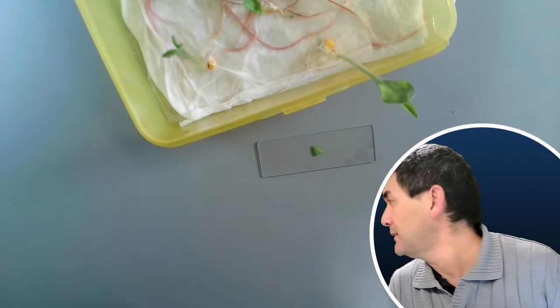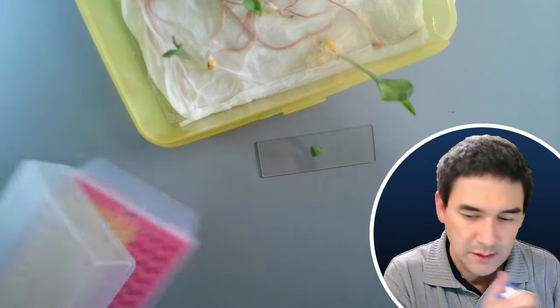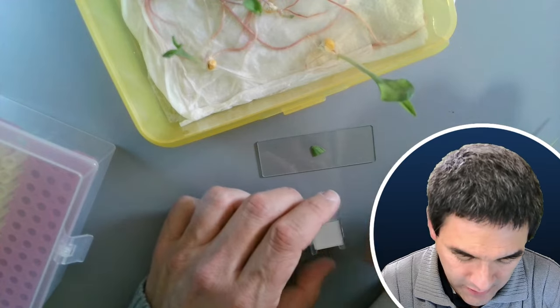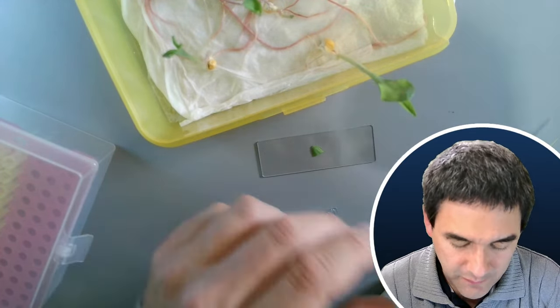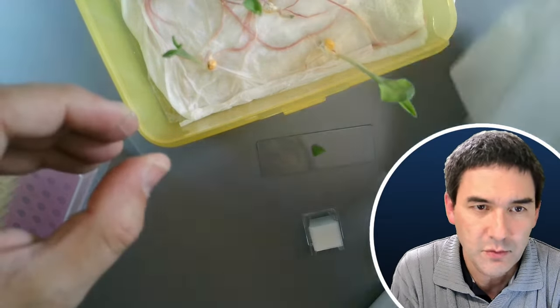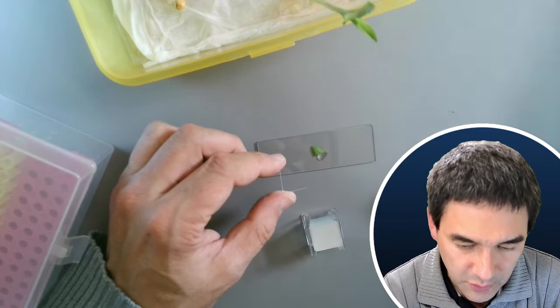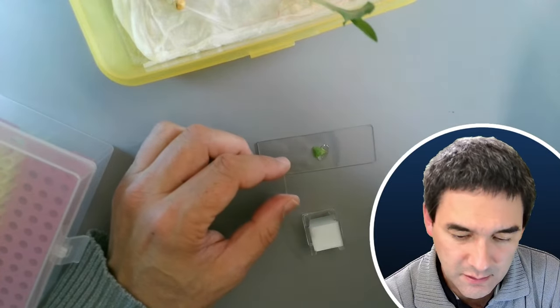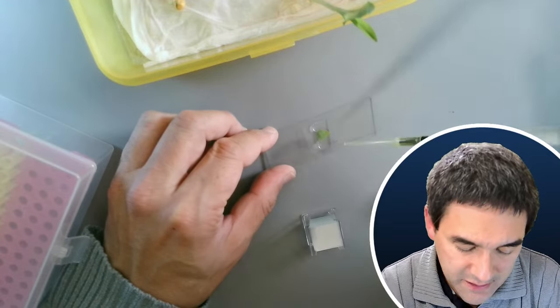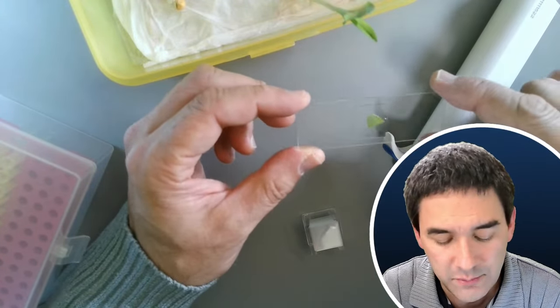I put a drop of water on here — water is important to make objects more transparent — and add a cover glass. It's way too thick. But maybe we're still able to see something. Let me switch over to the BX microscope view. As expected, very thick — but let's go up with the light a little bit and focus.